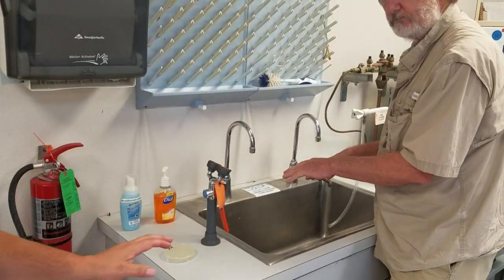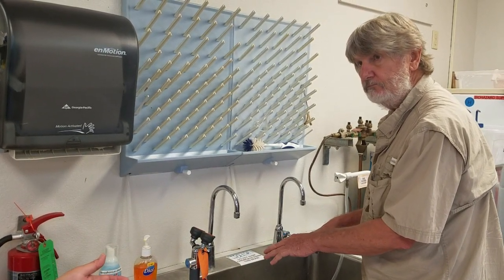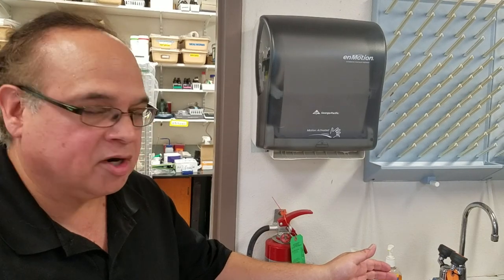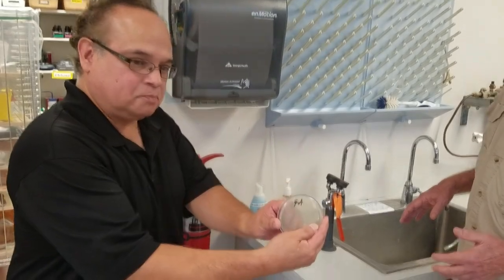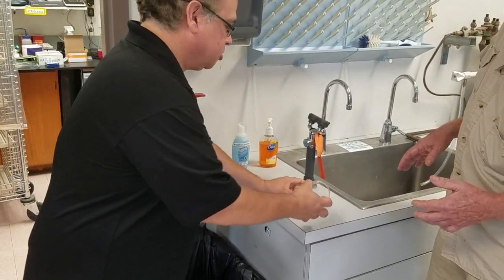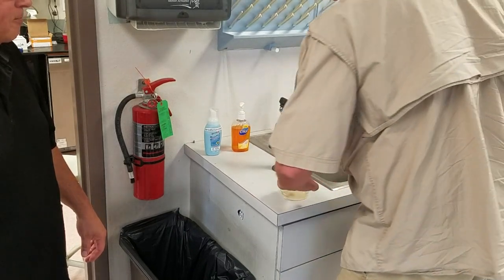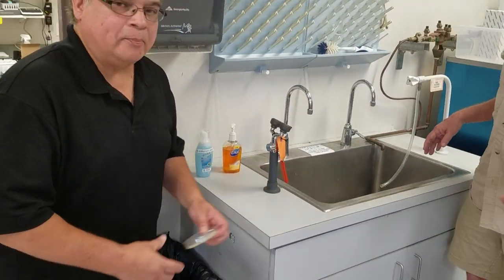If we were to take an impression of his hands right now with water on them, the organisms would go crazy, because one thing all living things need is water. So we're going to let his hands dry for a minute. Dr. John's hands are now dry, and he'll make the after-treatment impression. These will incubate at a permissive temperature — 35 to 37 degrees, body temperature — for about 24 hours, and then we'll share the results.